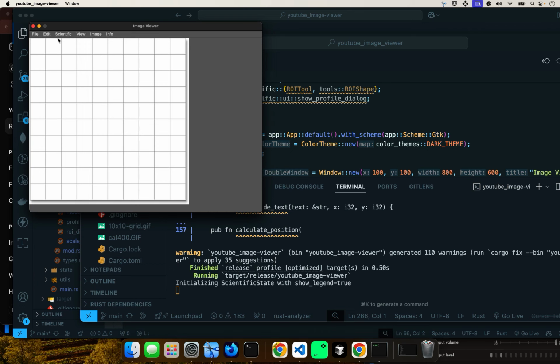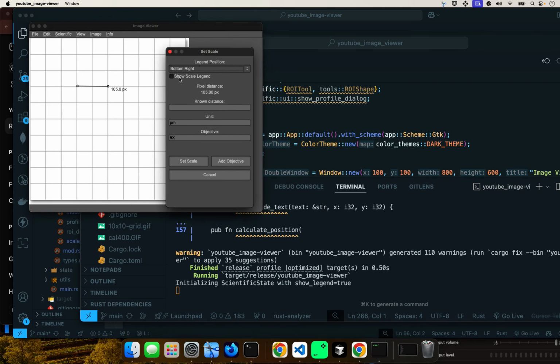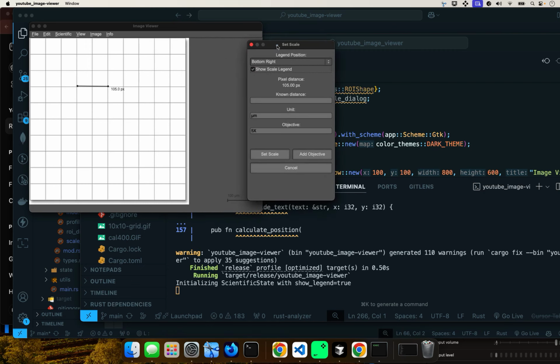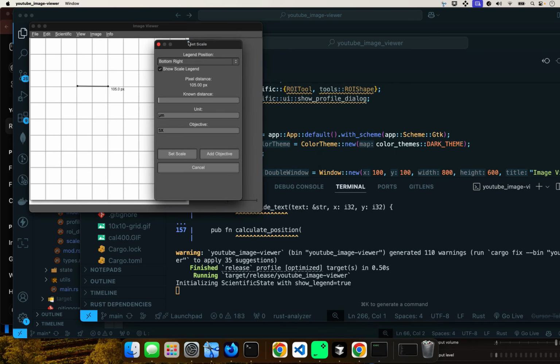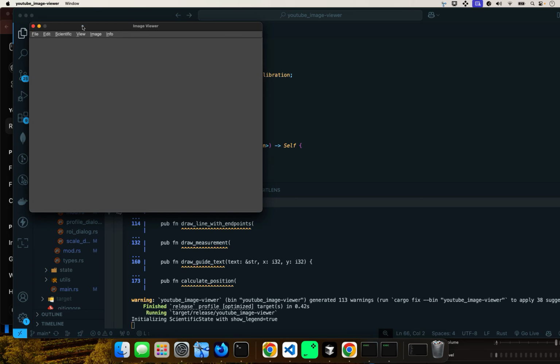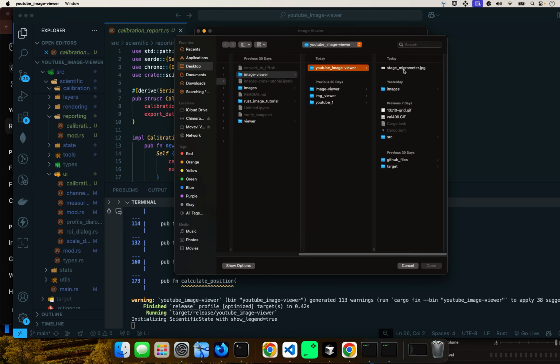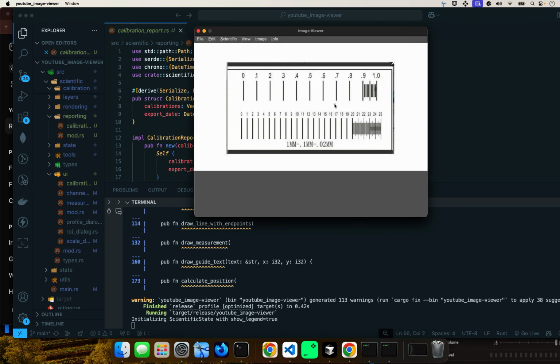We were able to choose scale bar and then drag and then show the scale legend, which shows you how to do that, and that's why you have the dialog. In this tutorial we're going to take it a step further, and it's going to be a lot more intuitive. So what we're going to do is open an image.